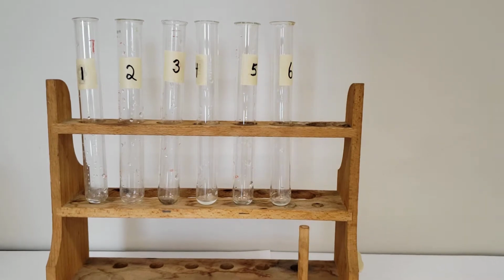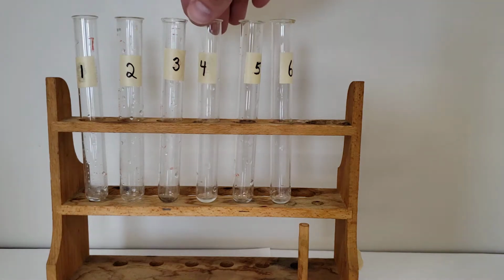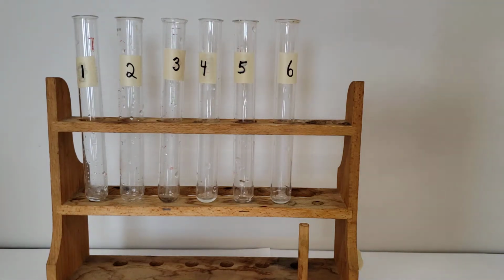So today we'll look at the single replacement lab. We have 6 different tests to do. The big thing here is to write down whether a reaction happens or not, note that down and provide the evidence that suggests that a reaction is happening, and then furthermore state if it is fast or slow. All right, so we'll start off with reaction number 1.